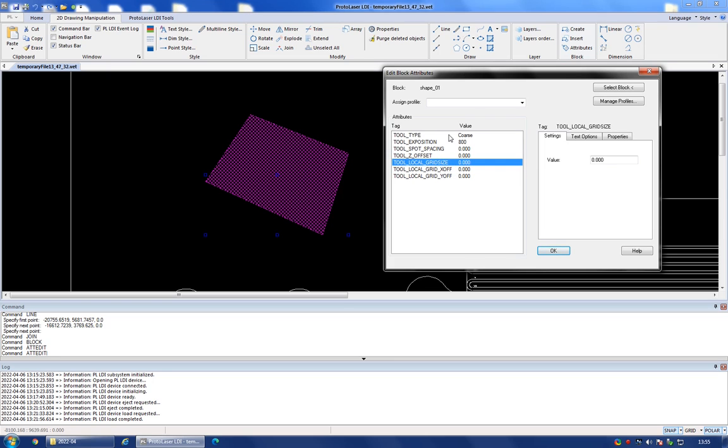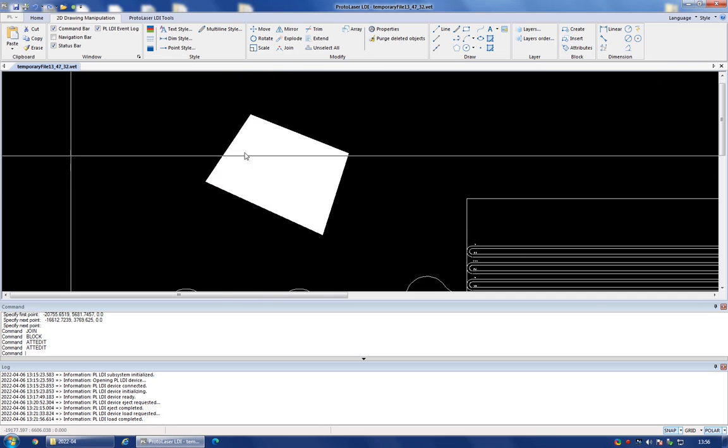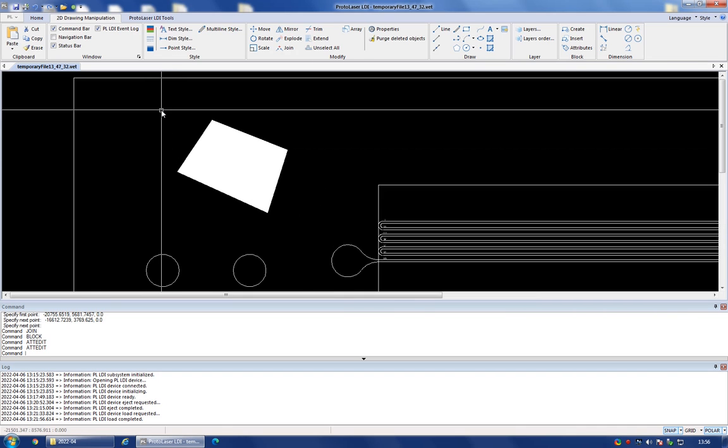So I'm going to stay with tool type coarse, tool exposure 800, and I can press OK. And this now is a shape that the laser writer will recognize as a region that needs to be exposed with the settings that I assign. Now, actually, this is not a shape that is useful for me, so I'm probably just going to delete it now.